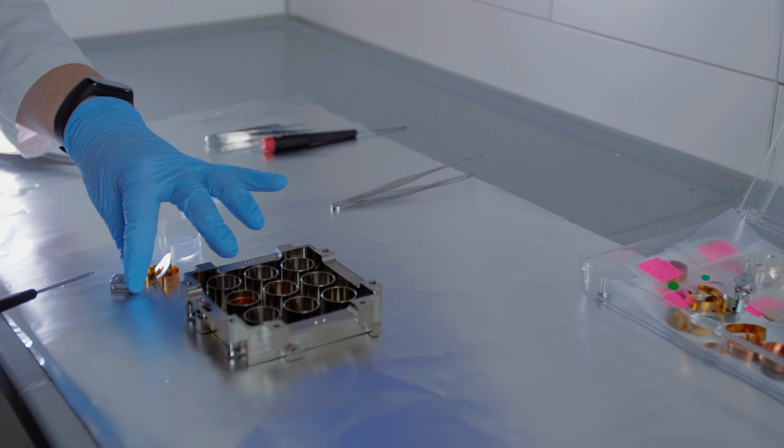Our ToF-SIMS may not be the best tool for quantification of different isotopes on geological samples, but it is one of the best instruments available for isotope distribution studies. Most methods for quantification are limited, with large analysis areas. For example, laser ablation ICP-MS has a minimum usable analysis spot of at least 100 microns, where ToF-SIMS has a usable spot size of less than 100 nanometers, which is 1,000 times smaller.